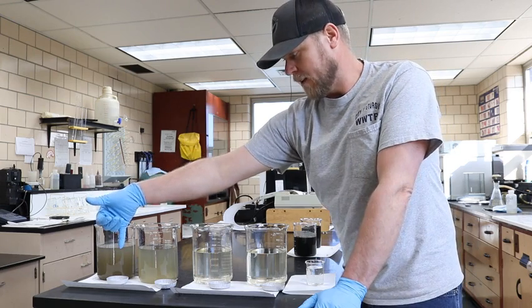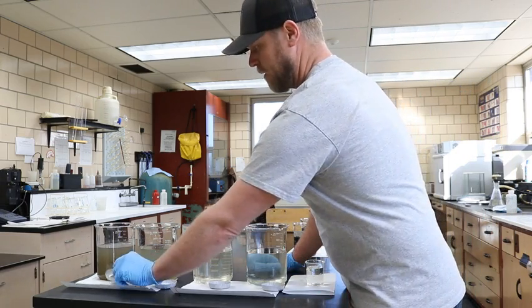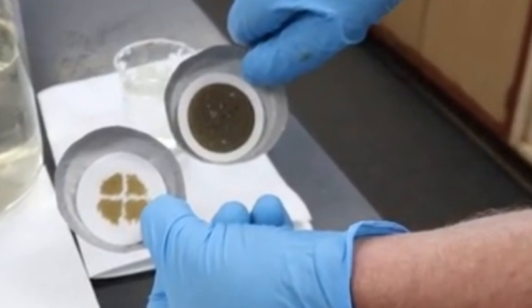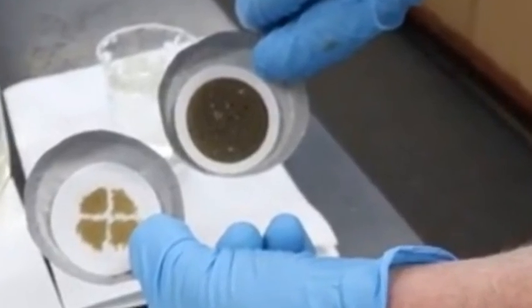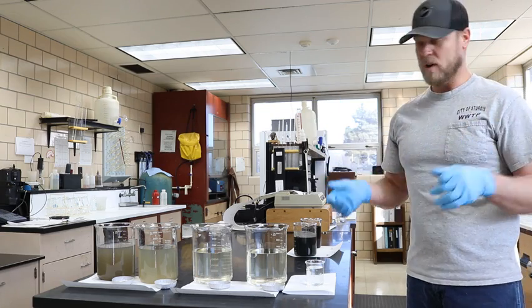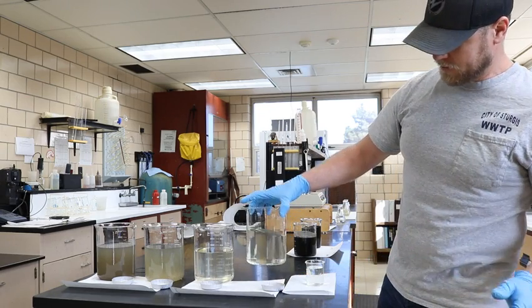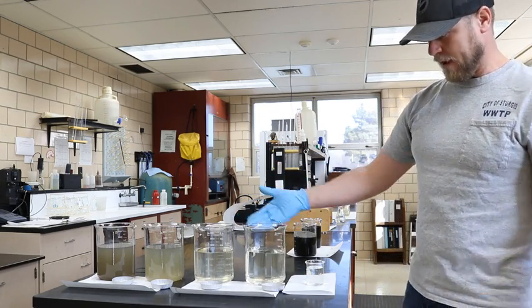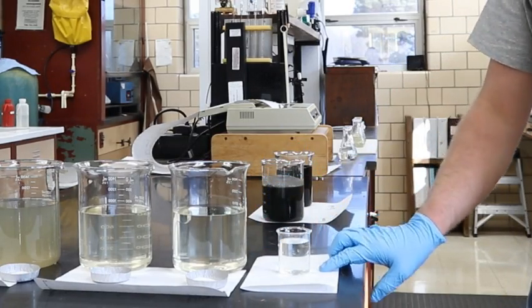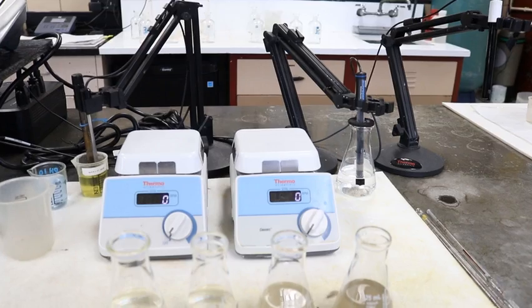This is actually one of our test parameters that we have to follow, and this is suspended solids. So what we do is we run a portion of a sample through a filter. We catch the solids that are suspended in the water, then we measure and weigh it, and that tells us the milligrams per liter that we need to follow. And it goes to our finals, which is our final settling process. You can see it's a lot more clear, and this actually is what is being sent directly to the river.